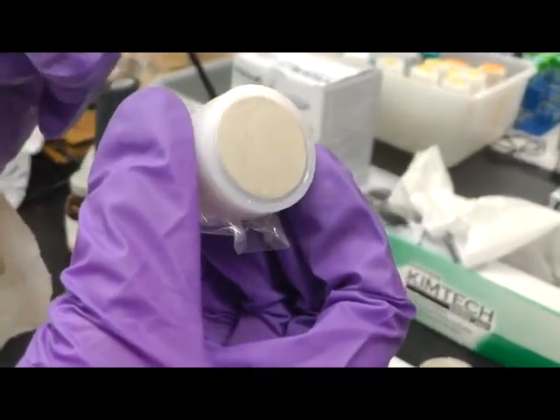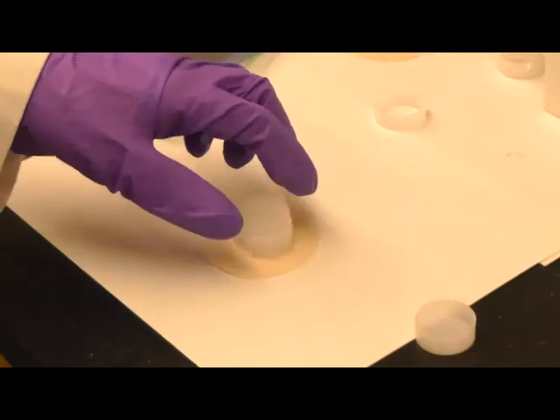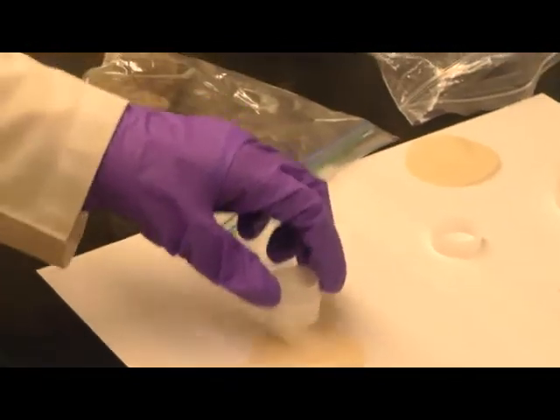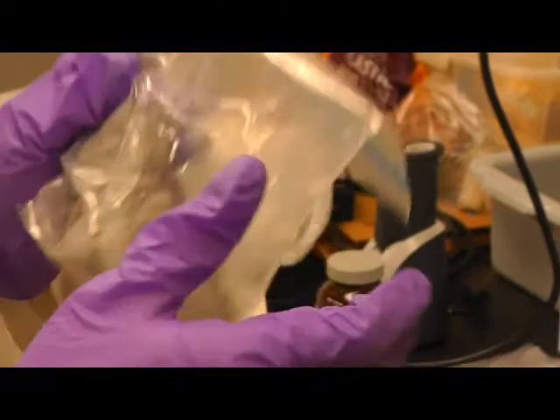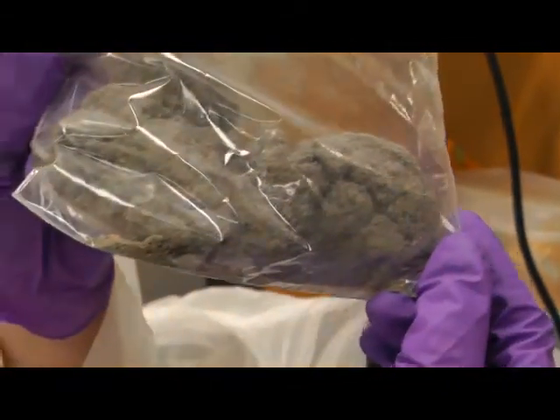And also a really flat thin film surface. Now we are going to make a second cup, which contains dust samples collected from one of our researchers' home, Zhao's home. So the dust sample looks like this.